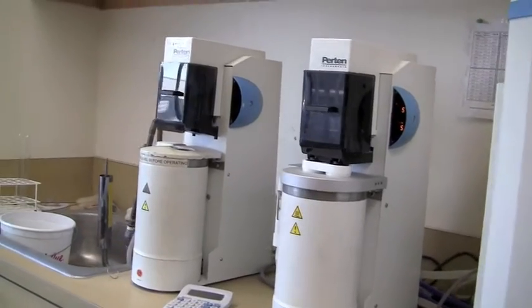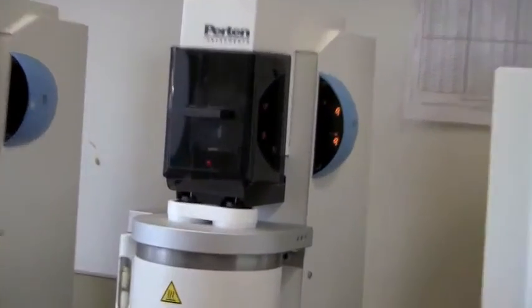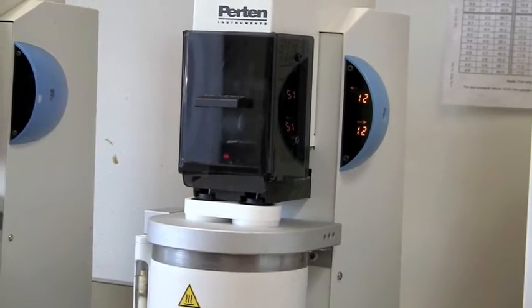This machine will now go up and down 110 times, which will take 55 seconds.